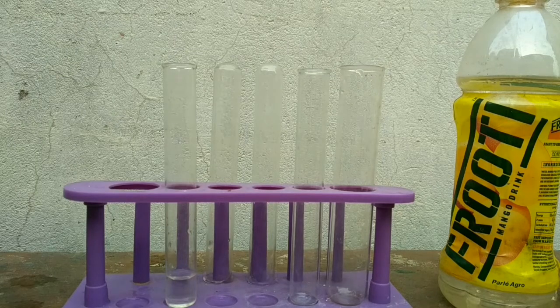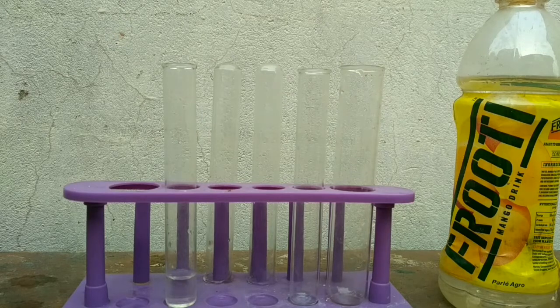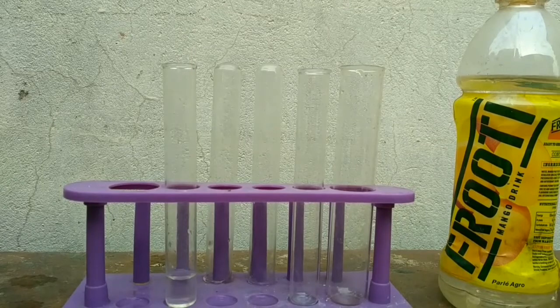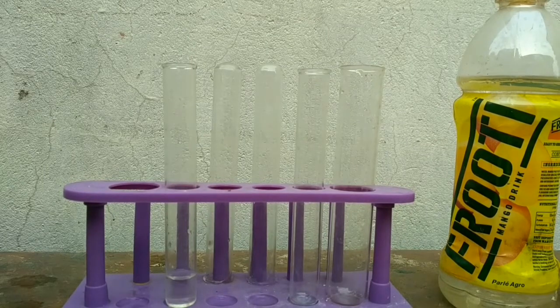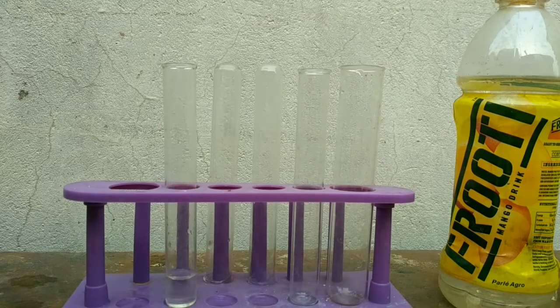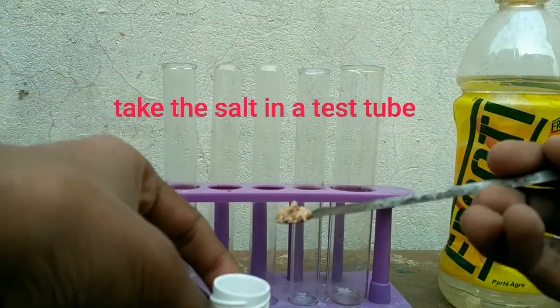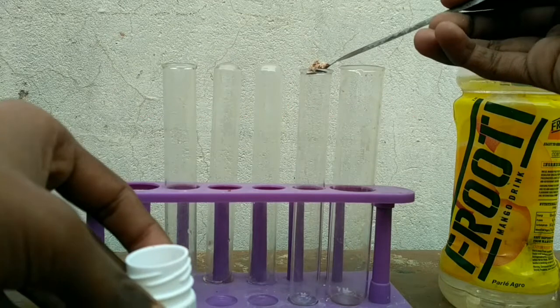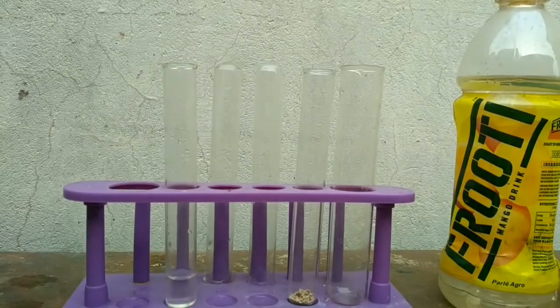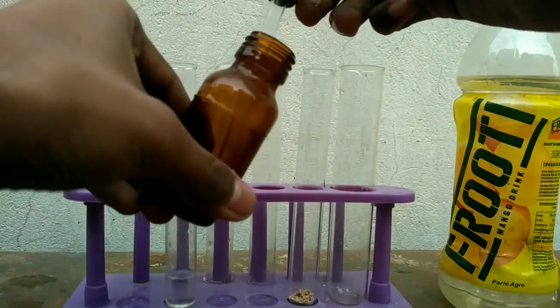In this video I will show you the test for oxalate ions in the given salt. First we will check for the dilute acid group, which will be absent. Now we will check for the concentrated acid group. Take the salt in a clean and dry test tube and add concentrated sulfuric acid.